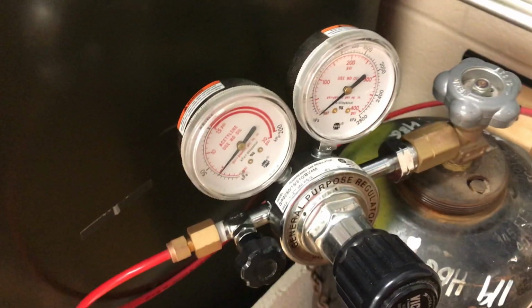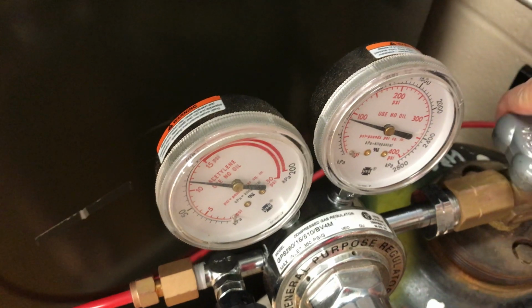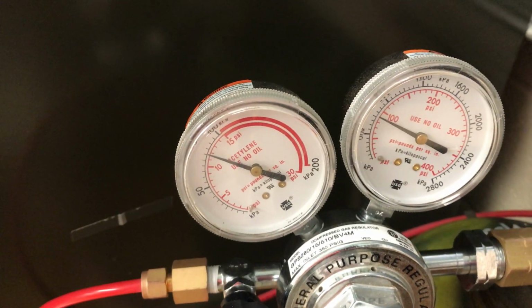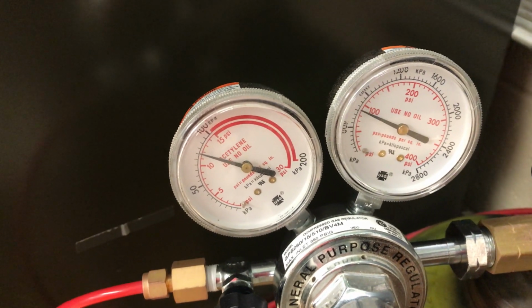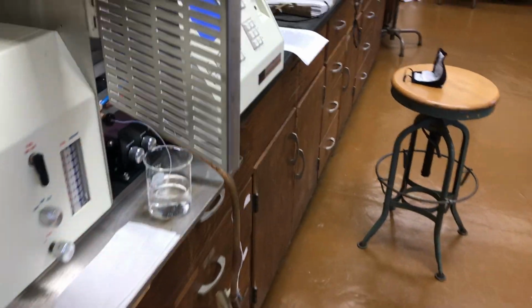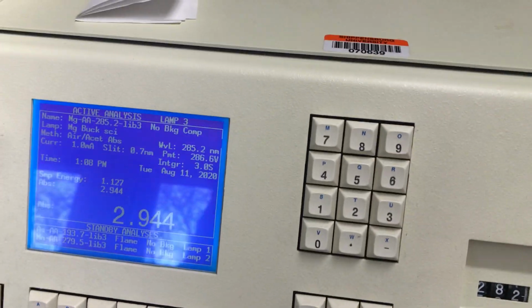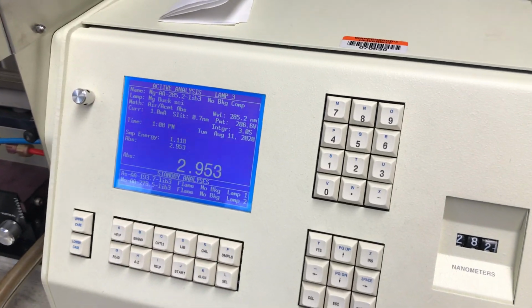We'll go ahead and turn that on, even though we're not going to turn the gas on right away at the instrument, but we just want to make sure here that we have sufficient pressures available. And it looks like we're right around 100 psi on the primary, and we look good on the secondary, so we should be good to go for this experiment. Again, we're not going to turn the acetylene on until we're ready to ignite the flame, and that will be done at the instrument. Alright, so that takes care of the acetylene tank.